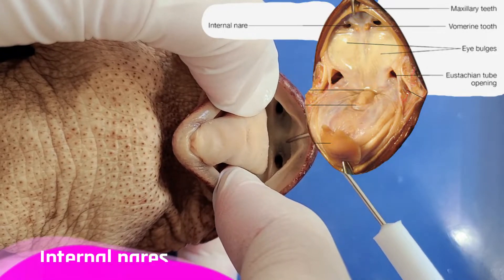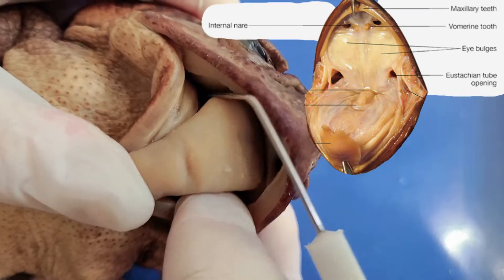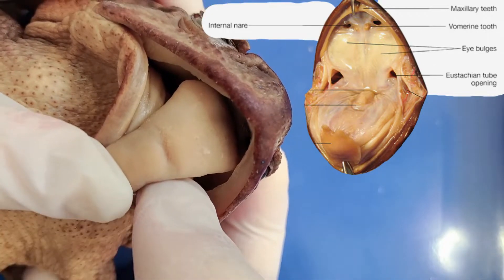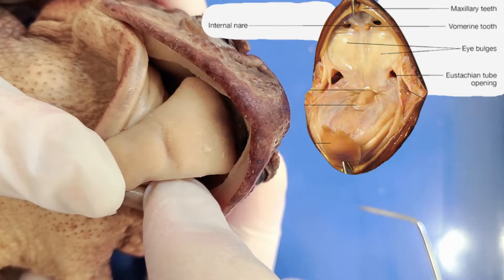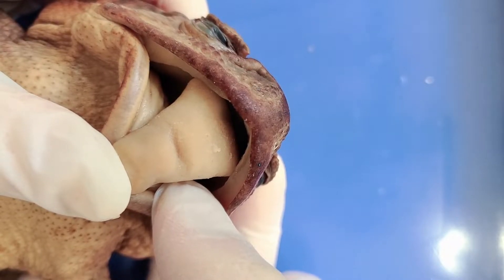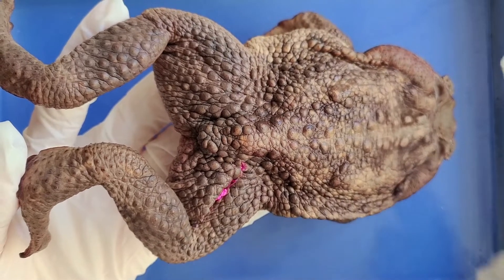The toad actually swallows by sinking their eyeballs down to push the food into their throat. These two holes here are called the internal nares and they lead out into the nostrils externally. There are also little holes called the eustachian tubes, which lead out into the toad's tympanic membranes. The eustachian tubes equalize the air pressure inside the inner ear and the oral cavity — we have eustachian tubes too, and if you've ever heard your ears pop on an airplane, that's your eustachian tubes equalizing the air pressure.